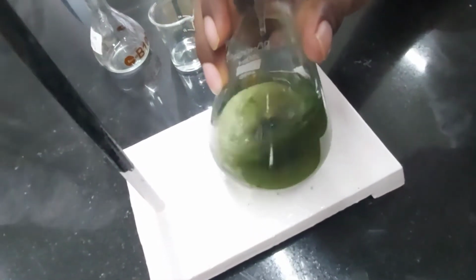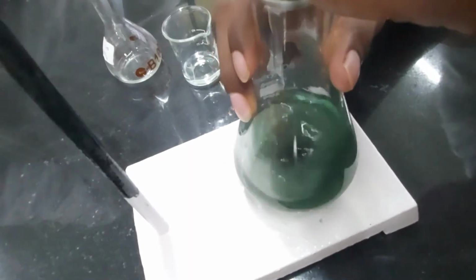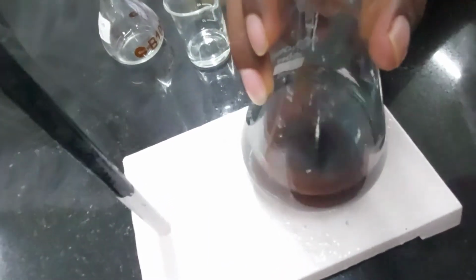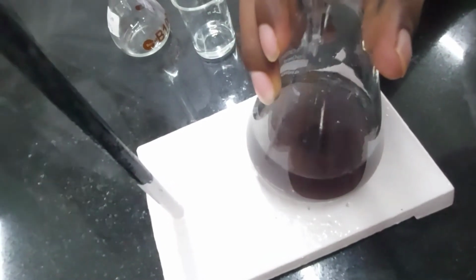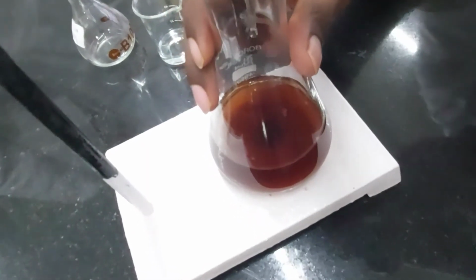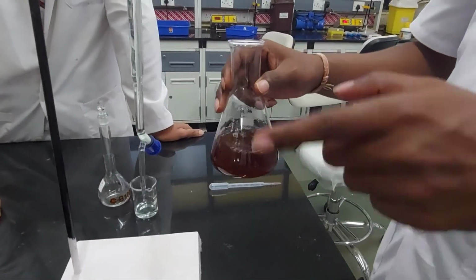Right. So you have to be extremely cautious once you start seeing that brownish complex formation. Yeah, this is the green color I was talking about. Now you go very slow. With every drop you are seeing the red. So you put the drop, swirl it, and see if the green color comes back, until it is permanently red. Is it permanently red? Yes, it's permanently red.